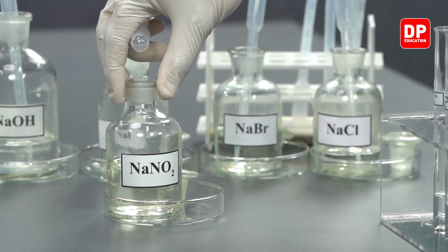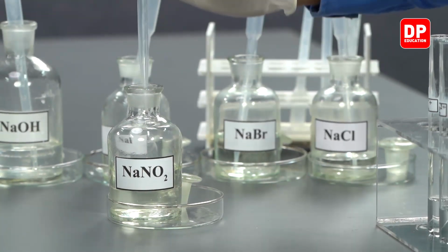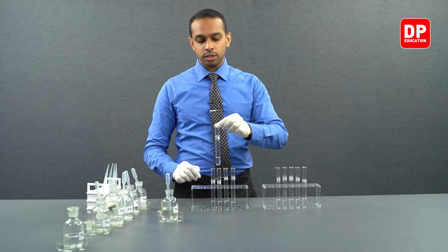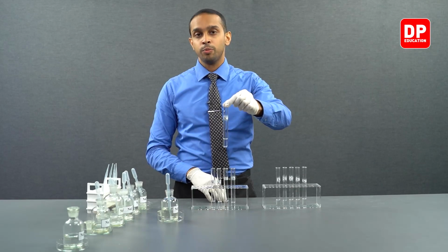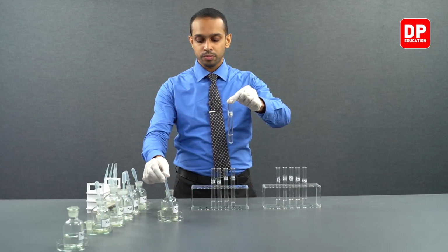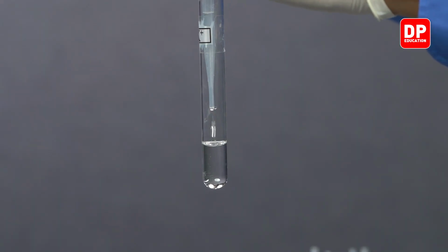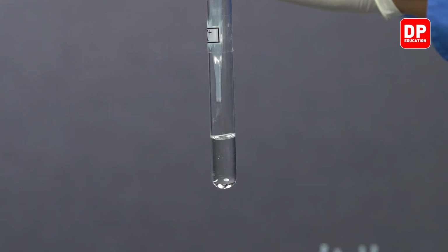So we have our sodium nitrite ion solution here. First, we will take a small amount of potassium 1 plus aqueous ion solution, and we will add a few drops of sodium nitrite.